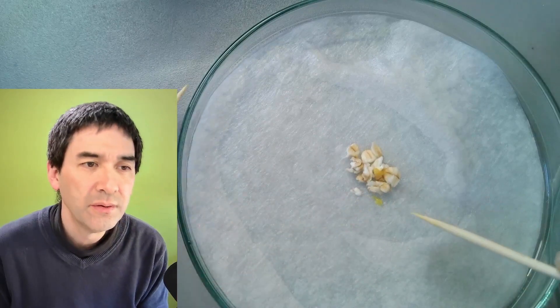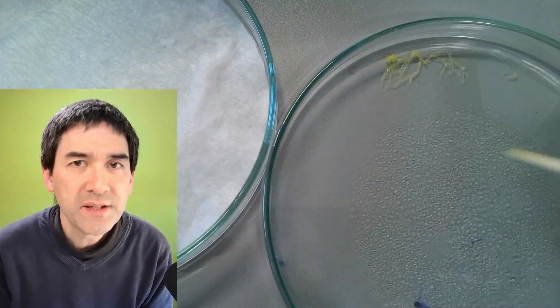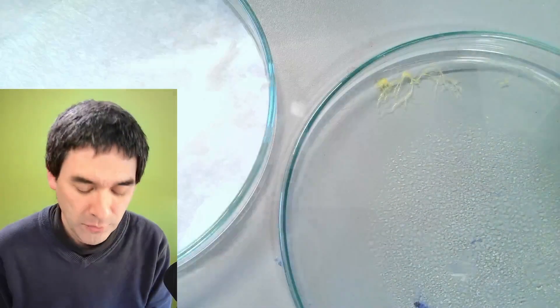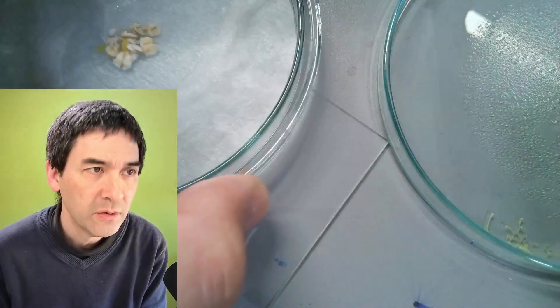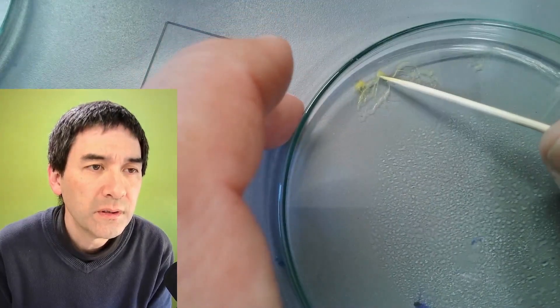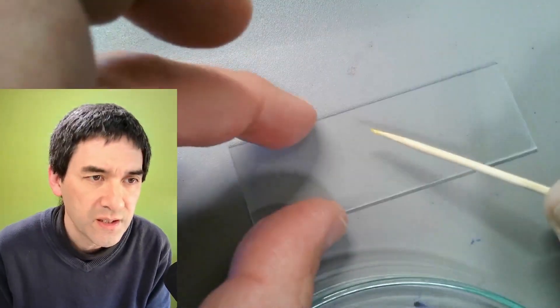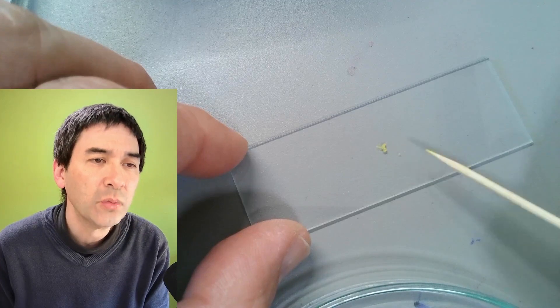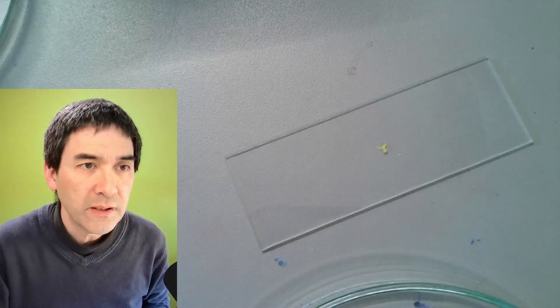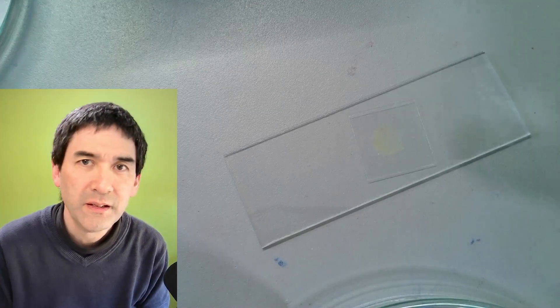That's basically all we need. Now I'm going to take some of this slime mold and put it directly under the microscope to see how it looks. I'll put the lid on the new dish first, then scratch off a little bit of slime mold here. Yes, that's all we need. I'm not going to add any water — I'm just going to drop a cover glass directly on top with a little bit of pressure. Very thin layer. Let's have a look.